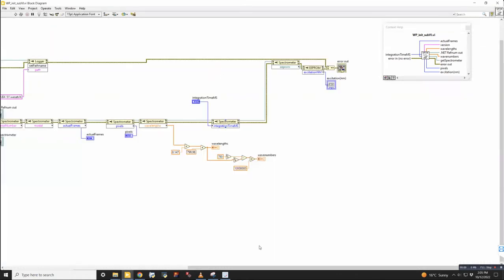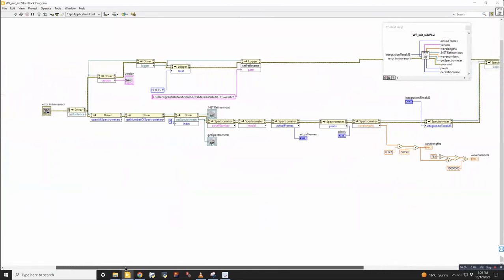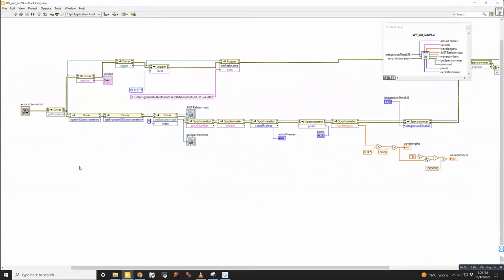So here is the initialization for the Wasatch spectrometer. This one has significantly lower level initializations. I don't think we actually wrote a lot of this. I think what this was is we took this and we started removing functionality from it. Wait, what do you mean? We added some functionalities to it. Oh, okay. Yeah, so these parts were part of the template that we used until the serial number and model. Right. And then until the actual frames.